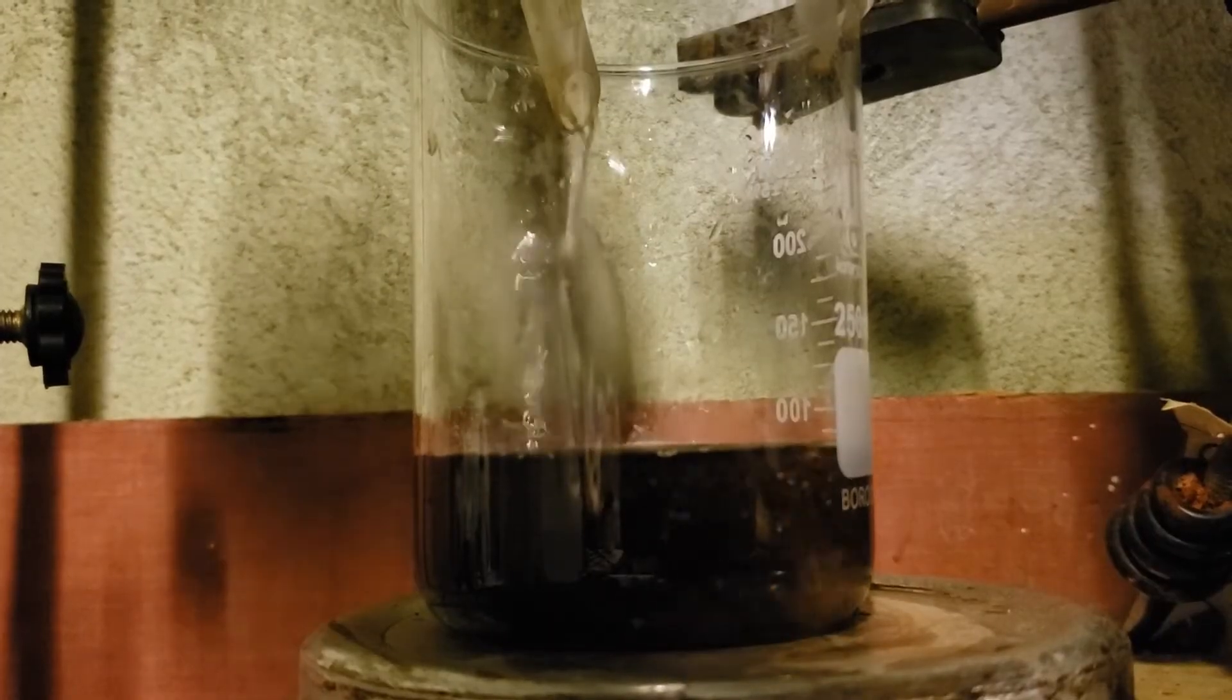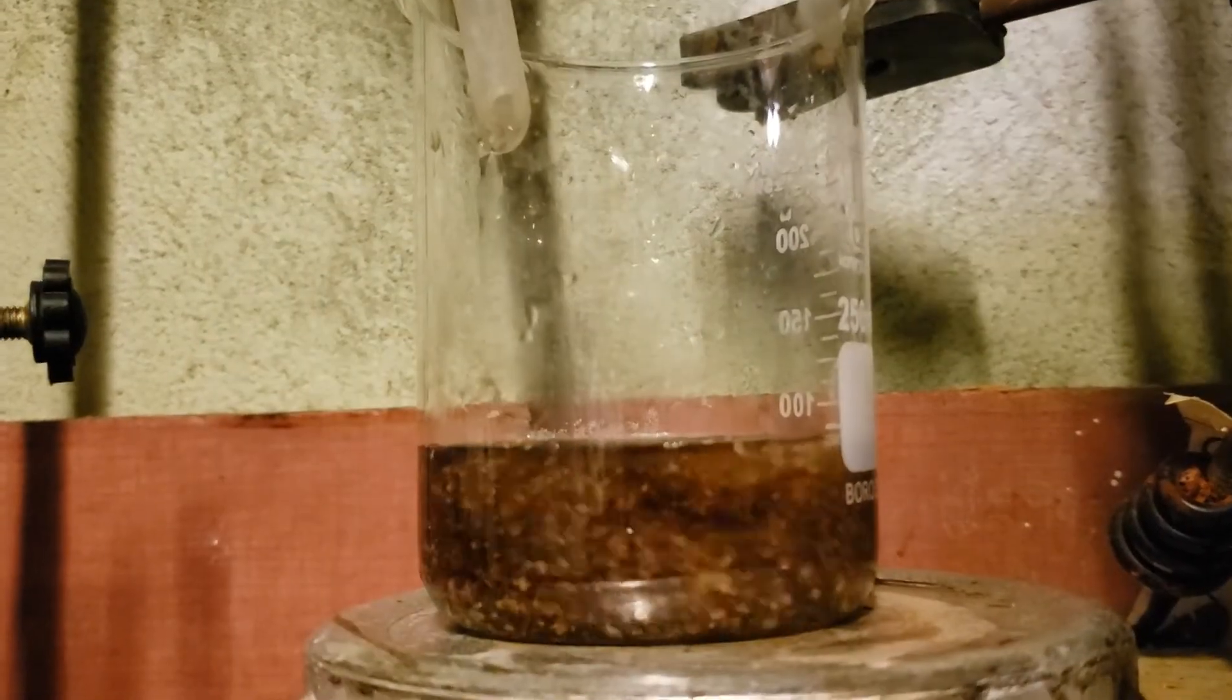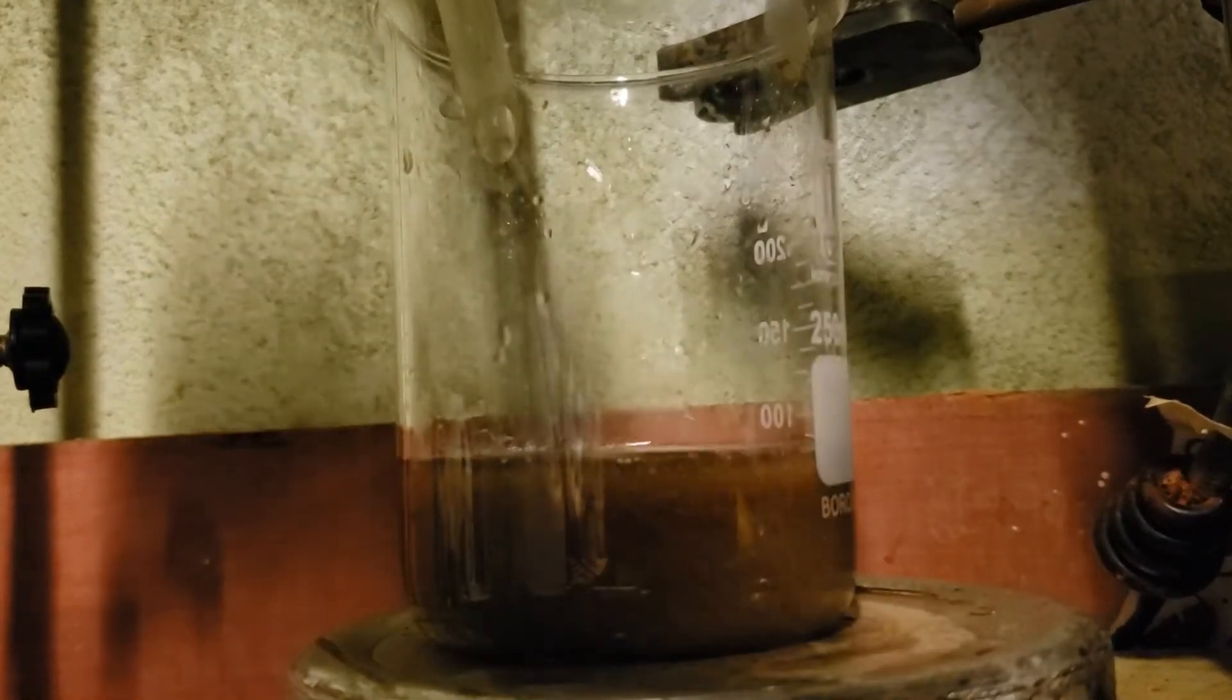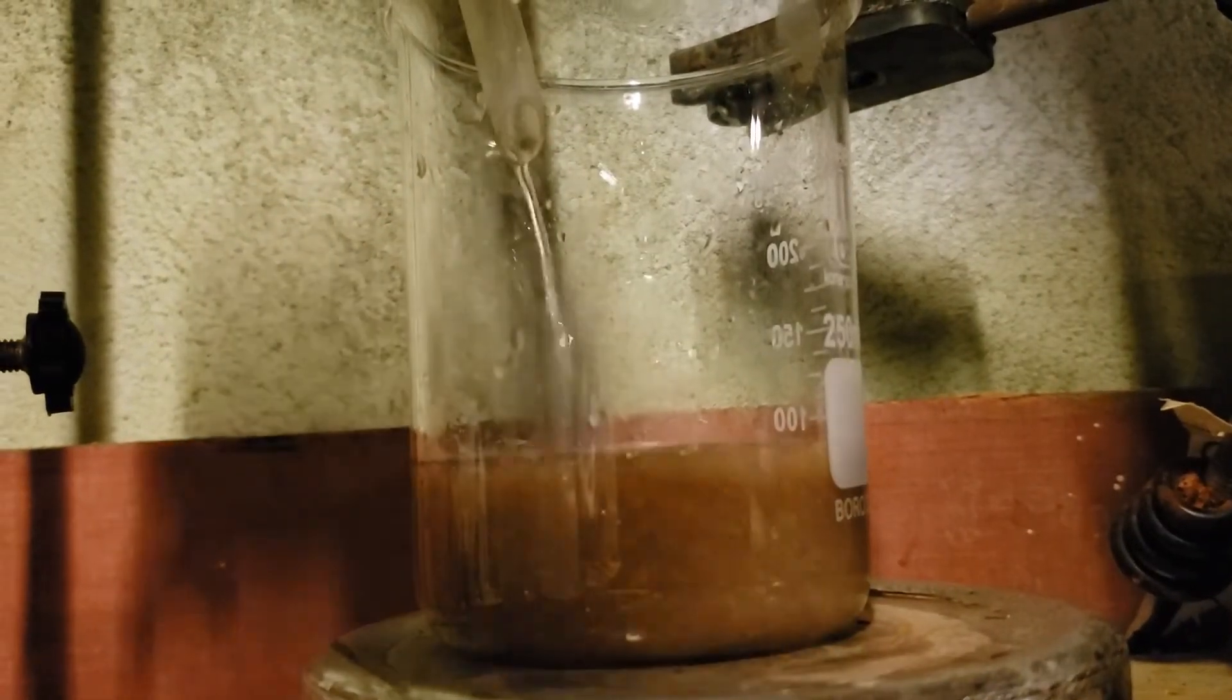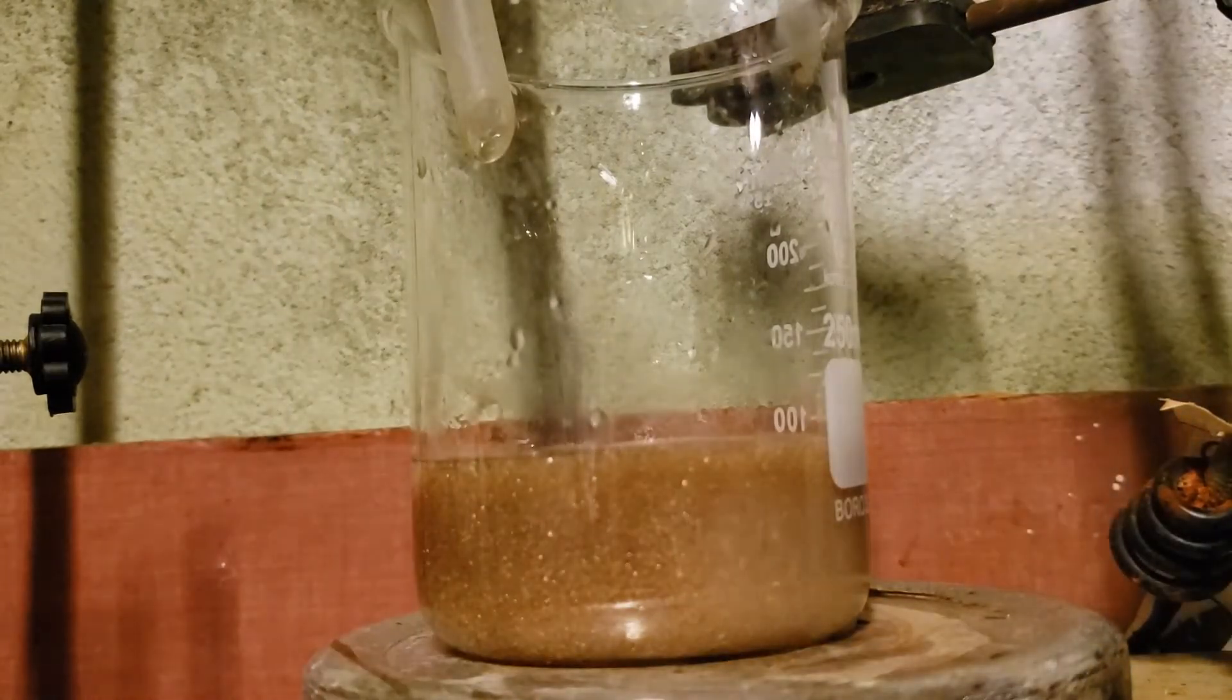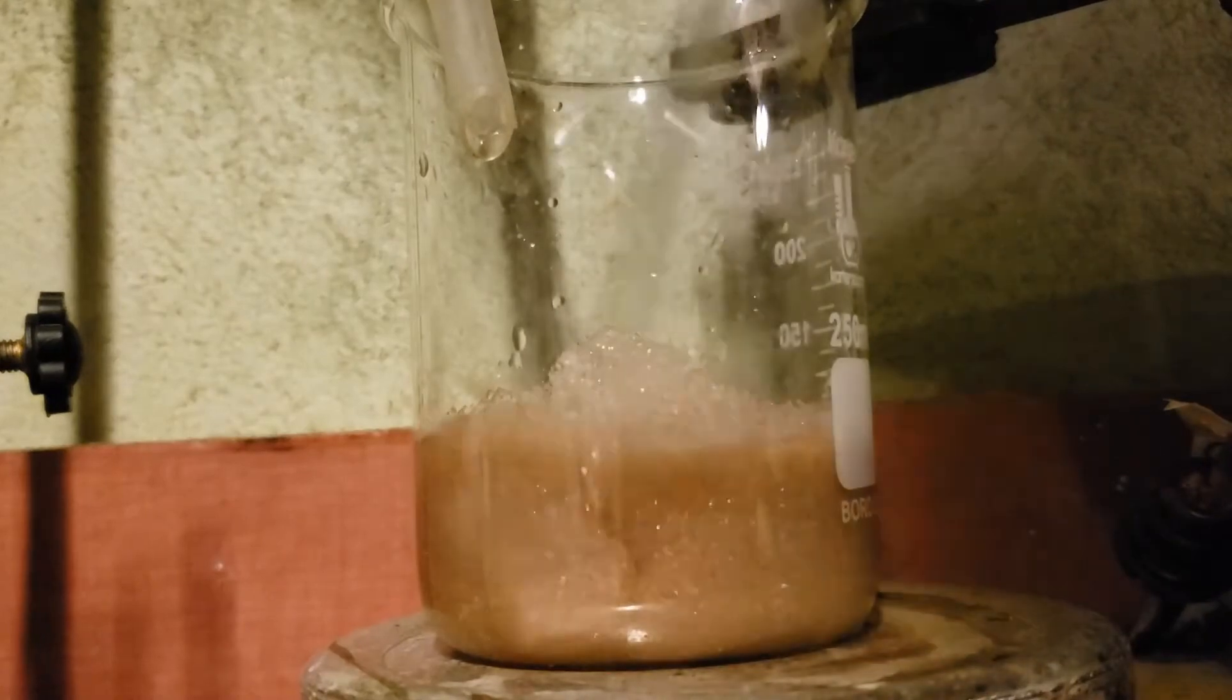A quick note on safety: orthophenylenediamine, like many other aromatic amines, is both toxic and carcinogenic, so it is important that you handle it with the utmost of care. What you did not see in the video were the huge evacuator fans running to suck out any fumes and my ABEK rated respirator.